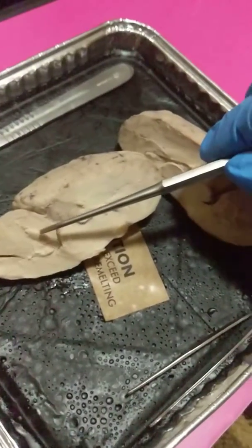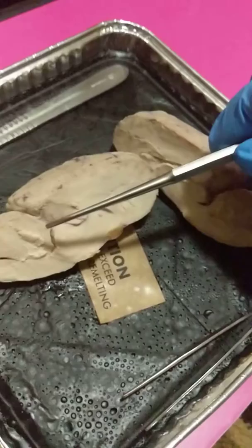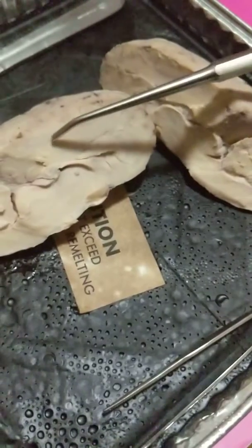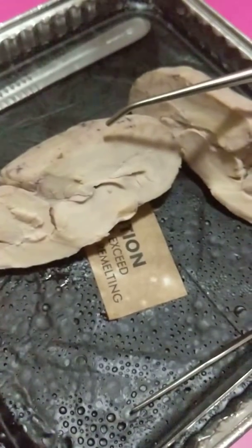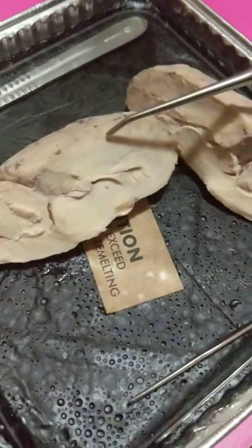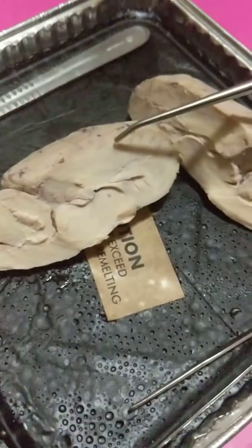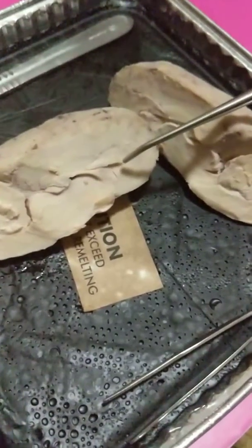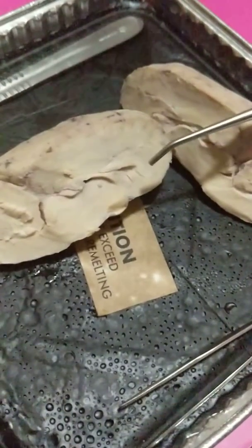And then there's also white matter, which are the inner portions of the cerebrum. You can see that in here, white matter. So there are bundles of axons within the brain that are contained here. The ventricles, I showed them earlier where they were, but they are the cavities in the brain that are filled with cerebral spinal fluid.